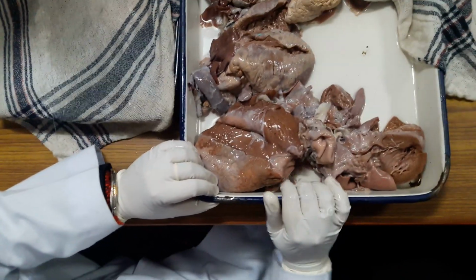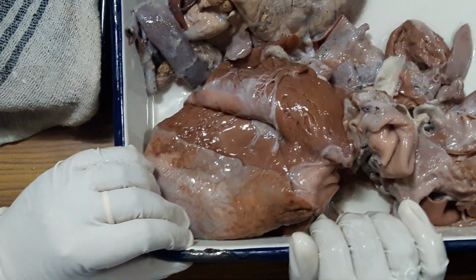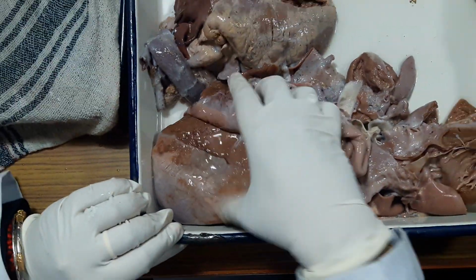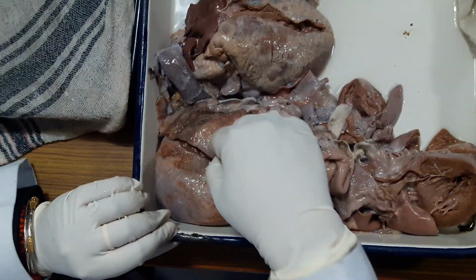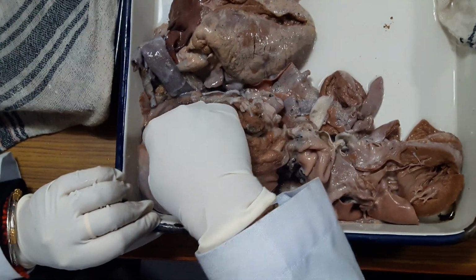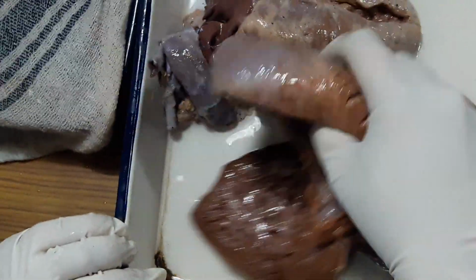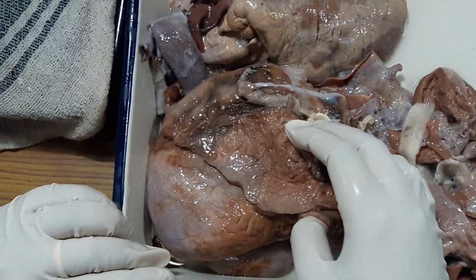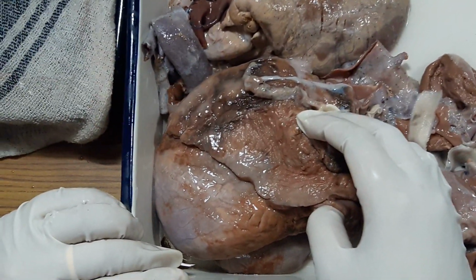Fibrinous pericarditis can be due to uremia. Okay. It can be as a result of myocardial infarction. Here it is not there. Maybe the patient had uremic pericarditis. Okay. In transmural infarction it is localized. You will be able to see infarction in the wall, and on that area there will be an area of fibrin deposition. Okay. This is due to hemorrhage. Probably the hemorrhage towards the base, the inferior surface, is due to cardiopulmonary resuscitation. Hemorrhagic pericarditis you get commonly with tuberculosis, tumor, and sometimes bleeding diathesis.